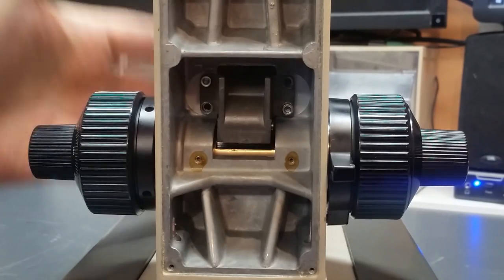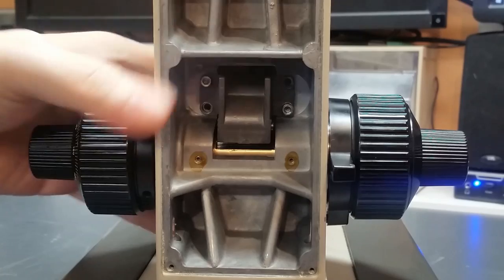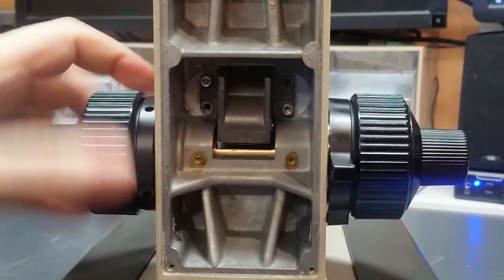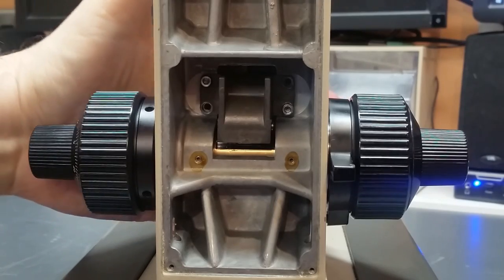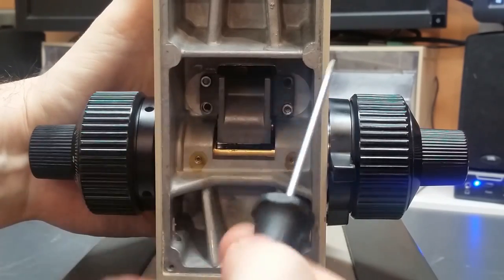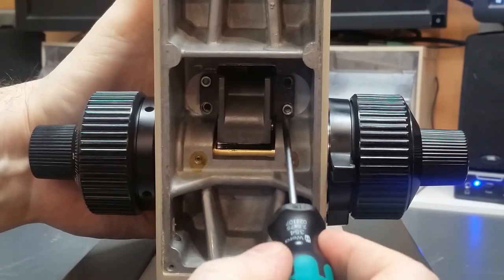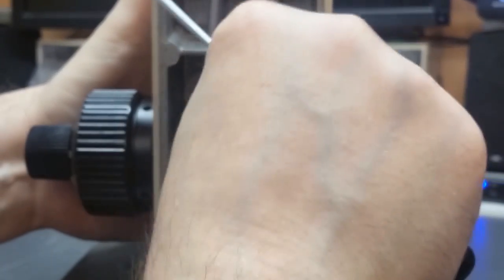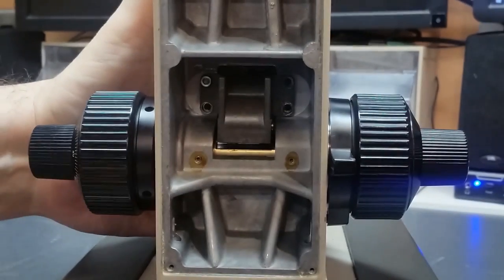Before I take those out, I need to reach around and grab the sliding focus block. As you turn this, the focus block raises up and down. And what I want to do is I want to grab this sliding focus block and support it, because when I take out these last two screws and the gearbox comes loose, that focus block is going to have a tendency to drop, and I don't want that. Screw three. Now this last one is when the focus block is going to really let loose.